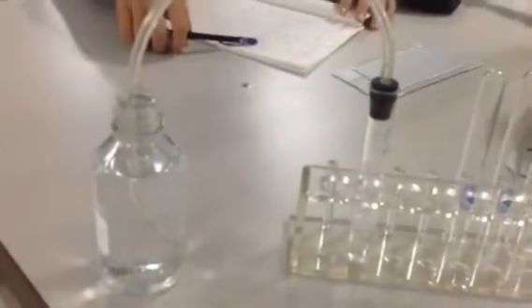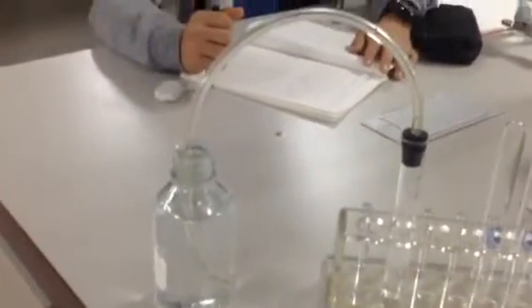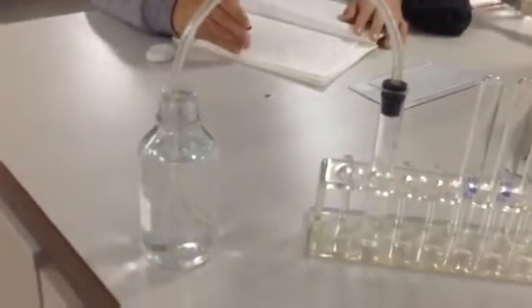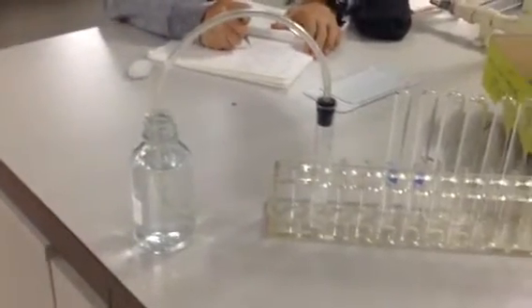Bubbles are forming. They can hear me. That's all they've got to do is hear me. Yes. But how can we know for sure if it's oxygen? Actually, I could do that, but that's a chemist question. At this point, take my word that it's oxygen. If you want to, one of these days I can do a quick chemistry test and show you. Chemists have devised tests over many years that tell you it's oxygen.